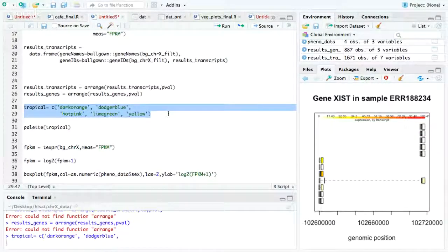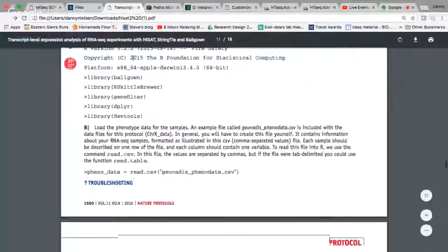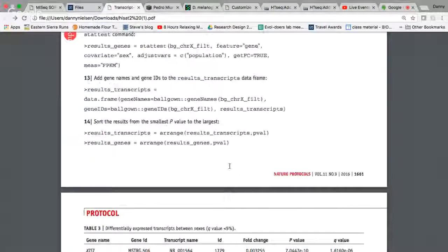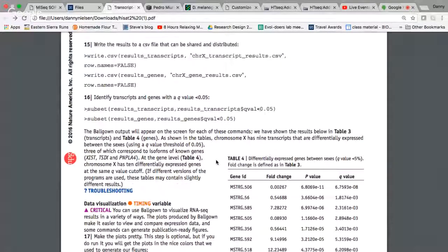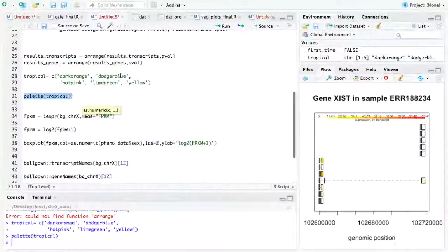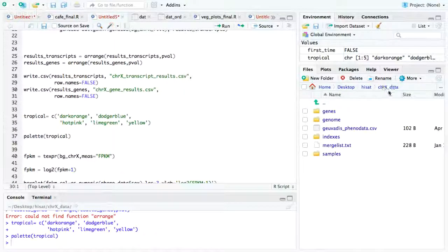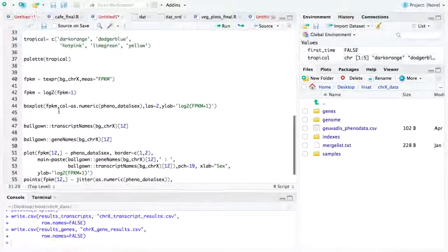Okay, so then we set up our graphics, and again, this is all from this protocol paper. So I've got the results. Doesn't look anything like his pictures. I could write these results to a CSV file. I am inside of this folder, so I'll write these, and I should have files that I can send. Okay, and then I'm setting up that. Now the next steps are actually to visualize this, and this is really the most important part because this is where you understand what the data are really telling you.